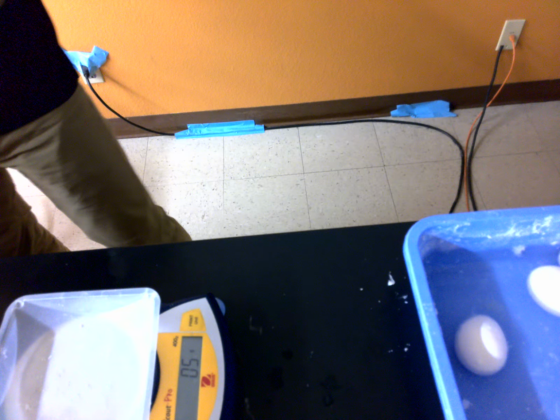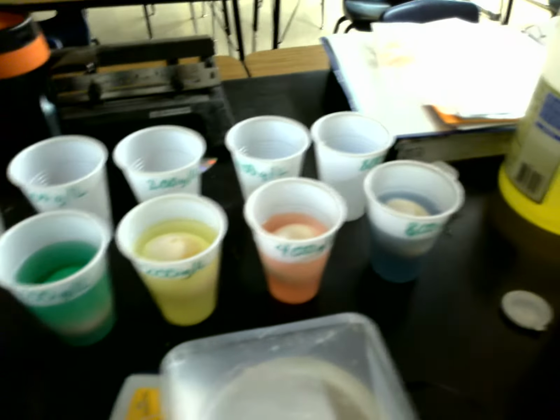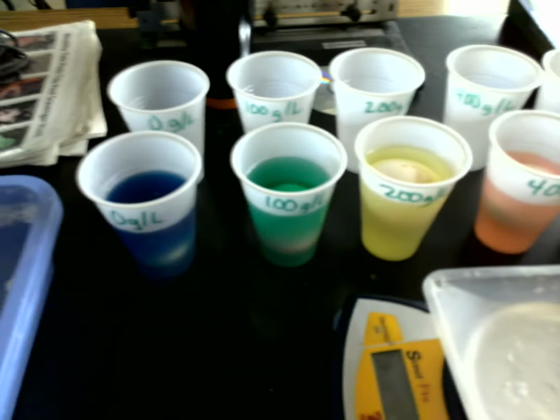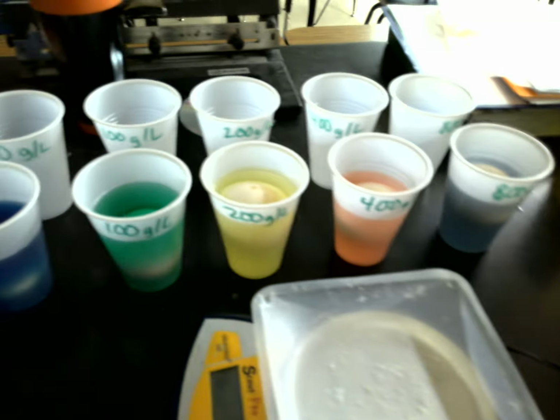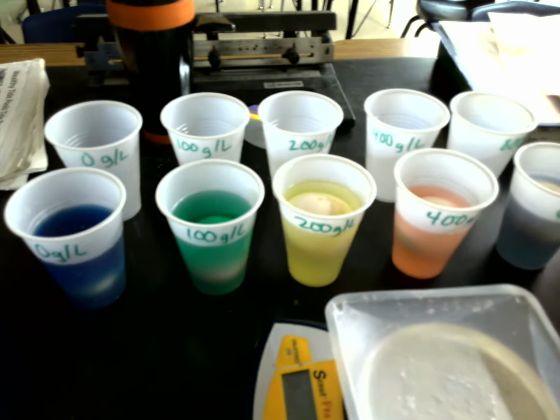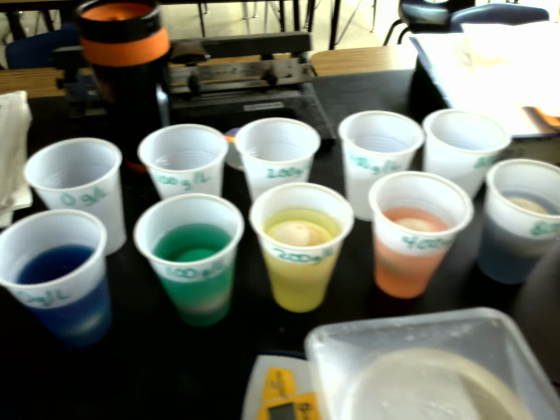All right, and so here I will show you our setup. Okay, we got 0, 100, 200, 400, and 800 gram solutions. And next time we will check their new weights, and then you guys will do a little bit of analysis on this lab. Okay, thank you.